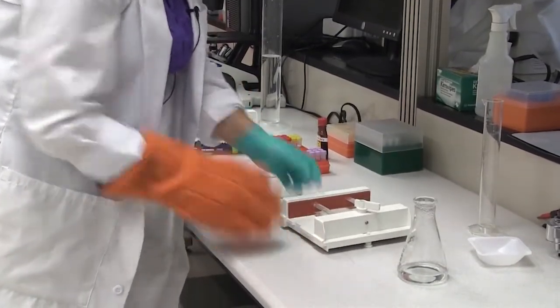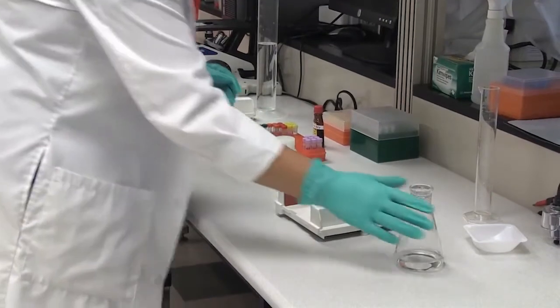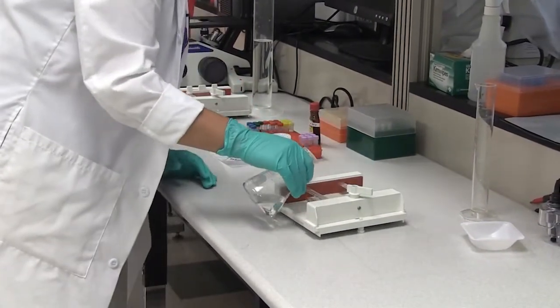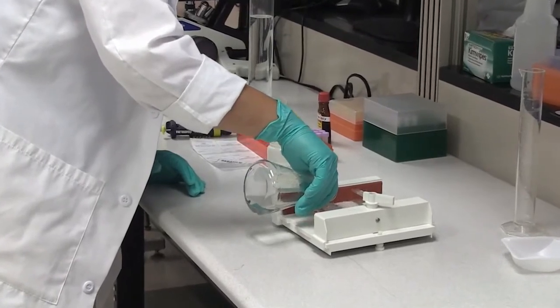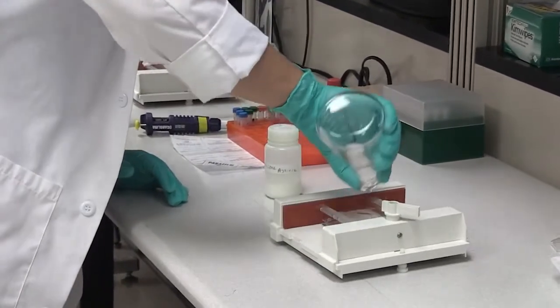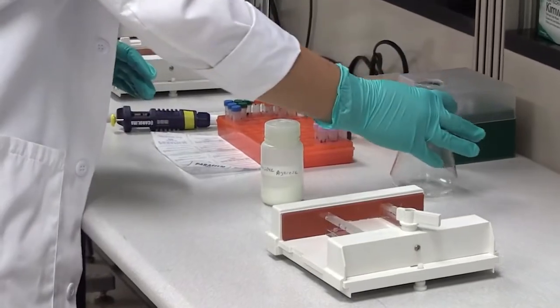Once that is nice and secure in the tray, you can take your flask of agarose and pour it into the tray.